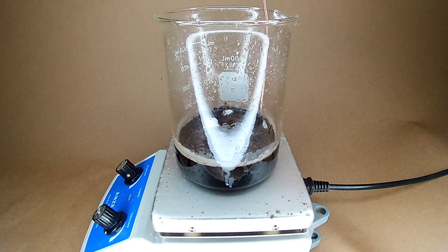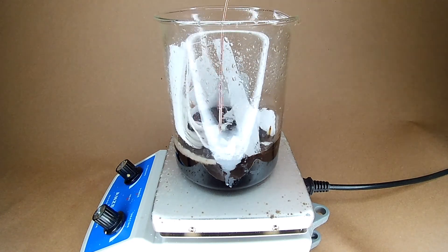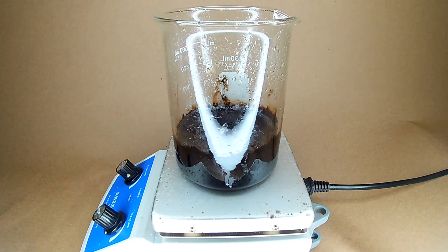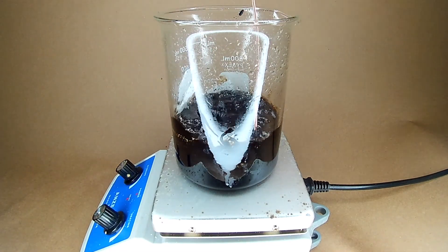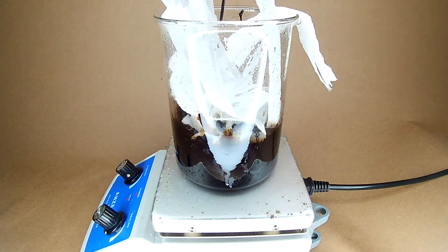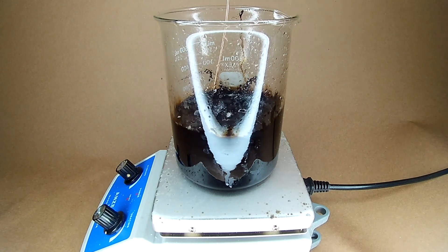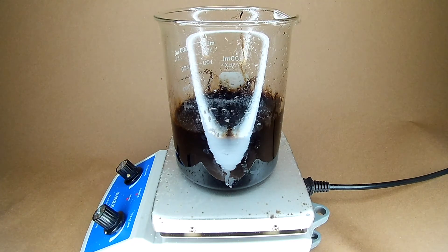That appears to work pretty well. Here's four more paper towels. The solution at this point has dissolved twice its volume, and now appears to be boiling.